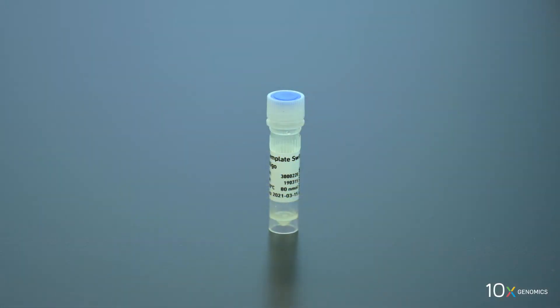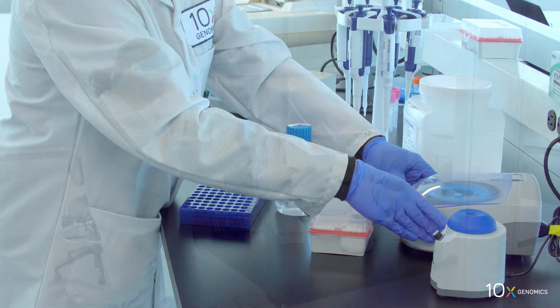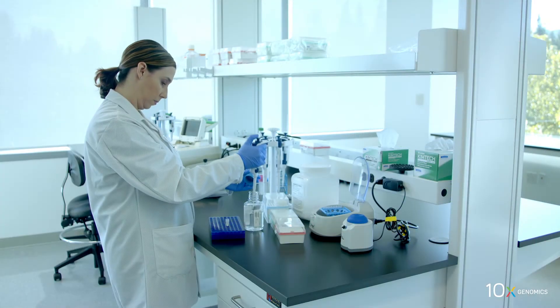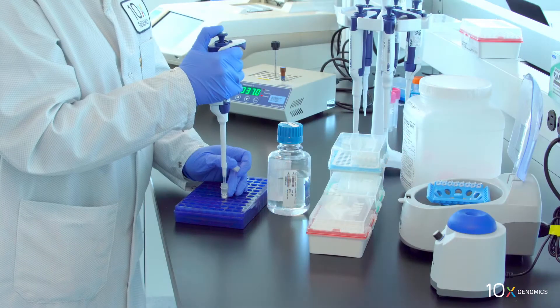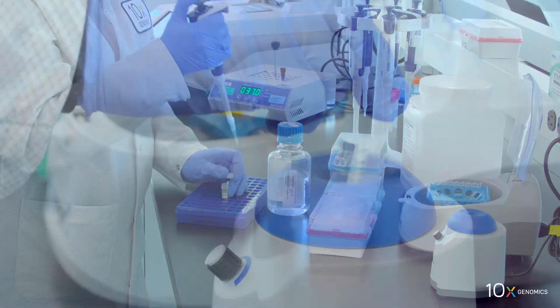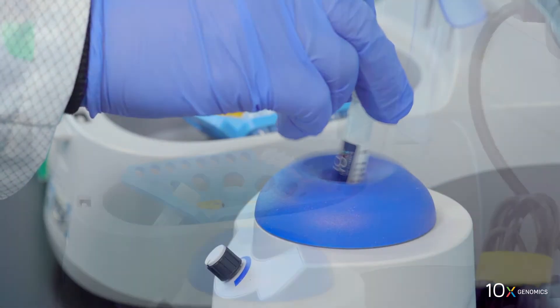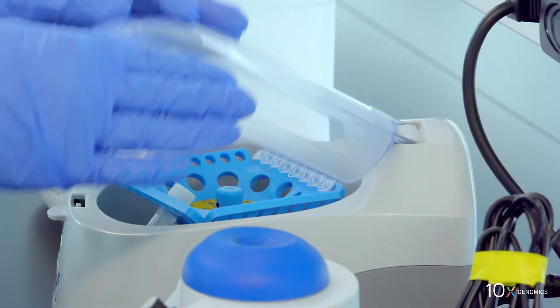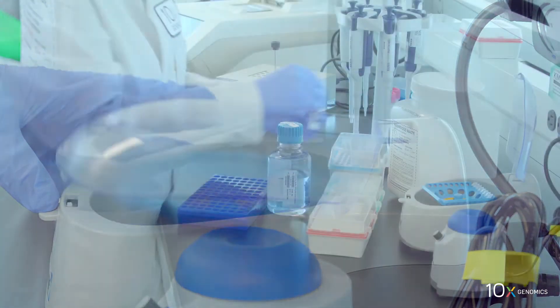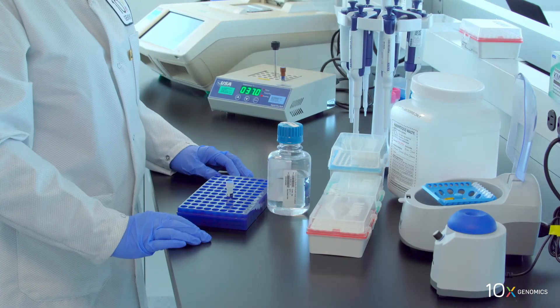Then we have template switch oligo. Spin down briefly, resuspend in 80 microliters low TE buffer. Vortex for 15 seconds at maximum speed. Spin down briefly, and leave at room temperature for at least 30 minutes.